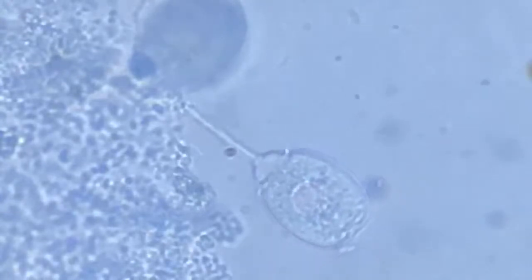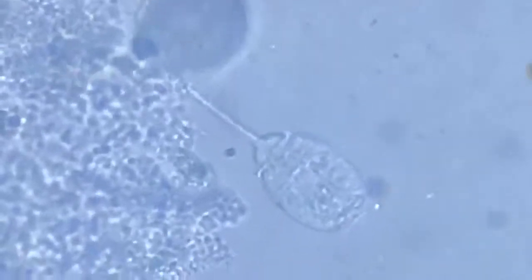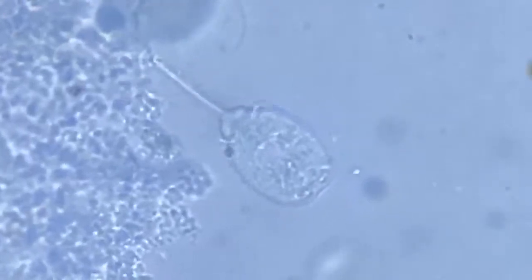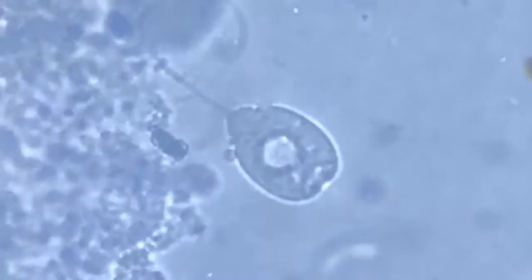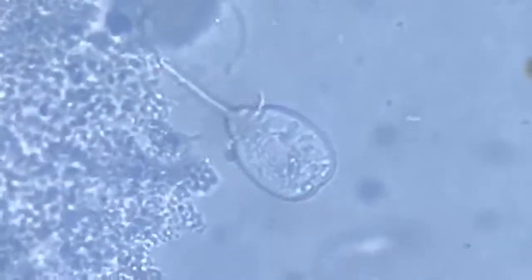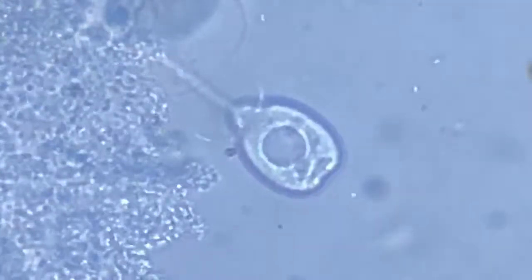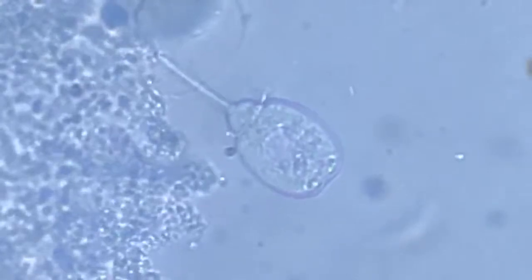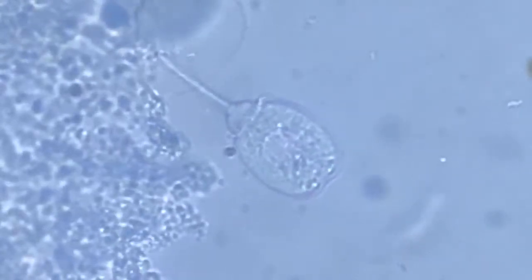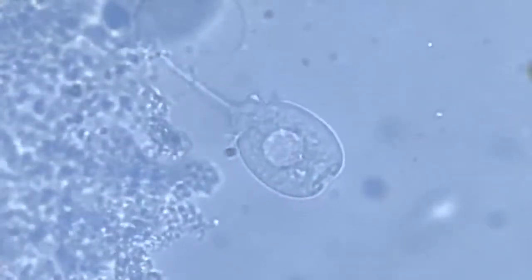First, there is a small circular lip-like opening on the tip, which slowly expands, and then once it expands, comes out a disc of flagella, and then that disc starts to beat. It's probably called the locule. I'm not very sure.